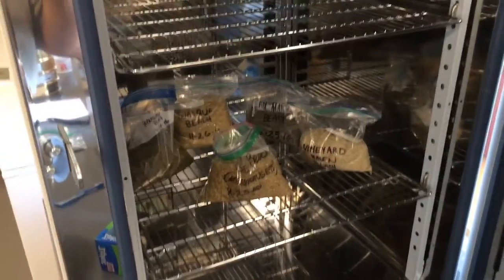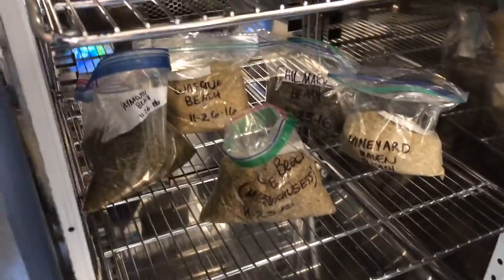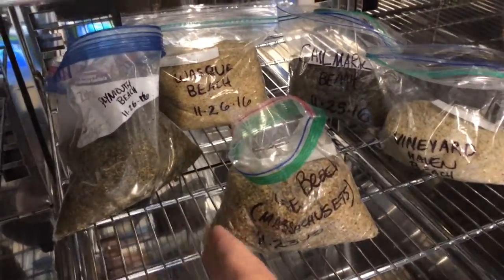Here's an example of good placement of sand to be dried. Now we can put this in either metal containers or plastic containers, but notice here in our small oven there's lots of air space. Still lots of air space around these few samples, and then nothing down here.